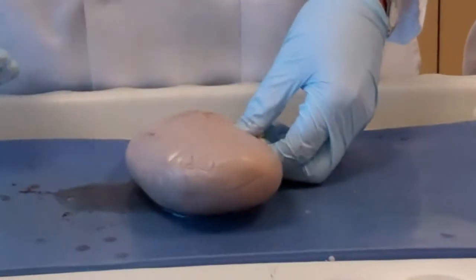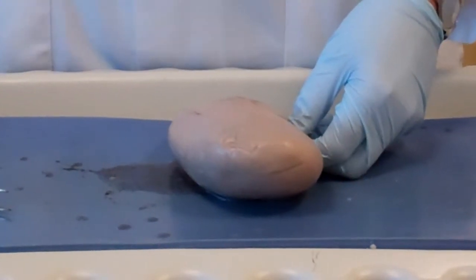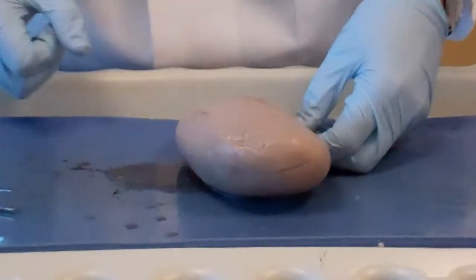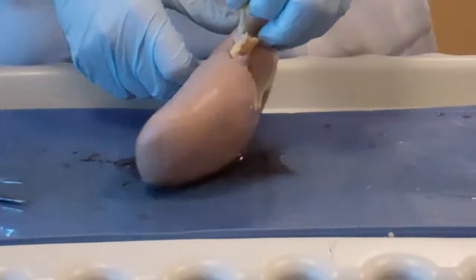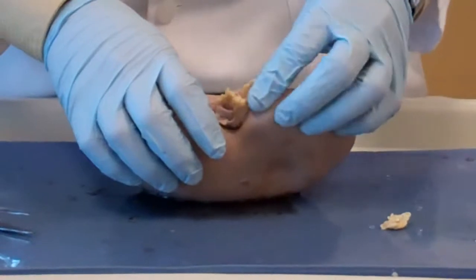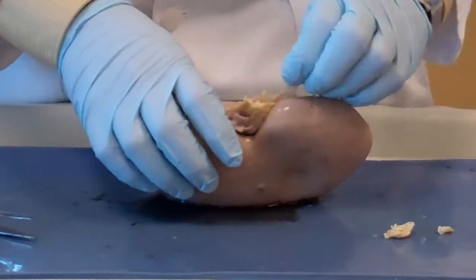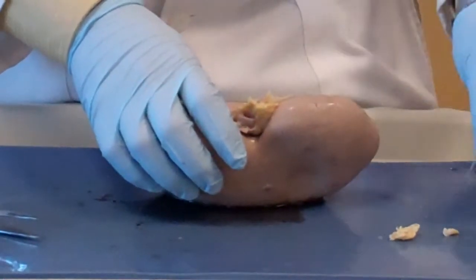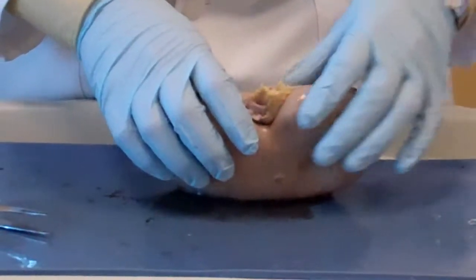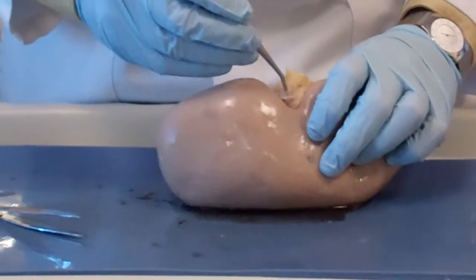Okay? So if you hold any hilum, the structures of the hilum, you can do the kidney, okay? So you know what a hilum is. It's the navel technically. Okay? That's the real translation of the word umbilicus or hilum. You can say hilum, sometimes you can say hilus. It is okay.